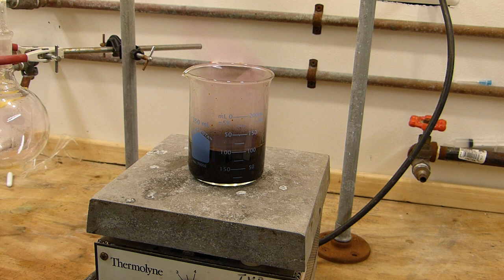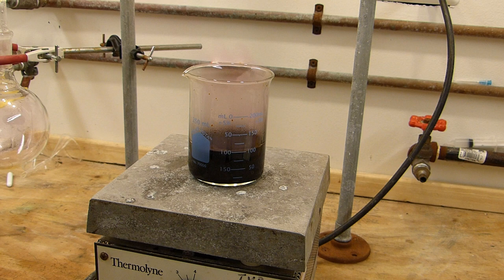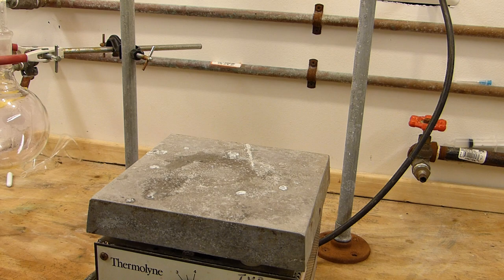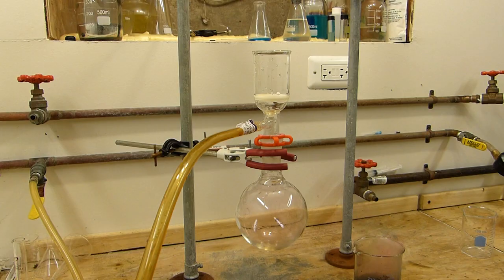A lot of the iodine loss can be prevented by turning the stir bar off and reducing the agitation of the mixture which reduces its surface area with the air. And we'll go ahead and do that and in fact I'll just set this aside so I can set up for vacuum filtration.